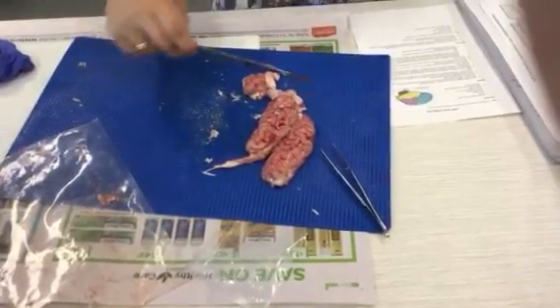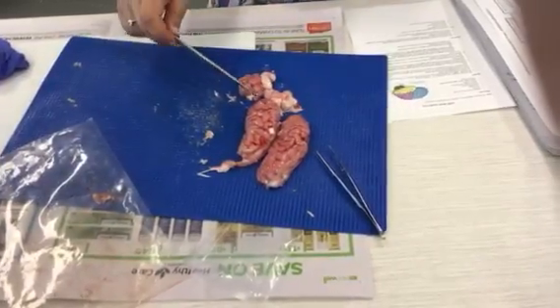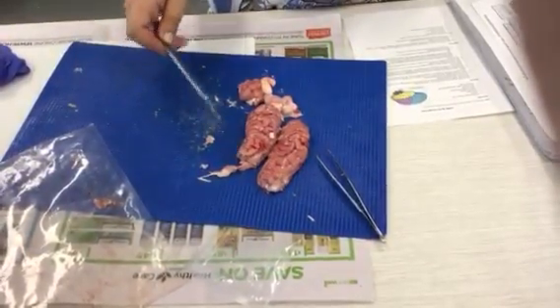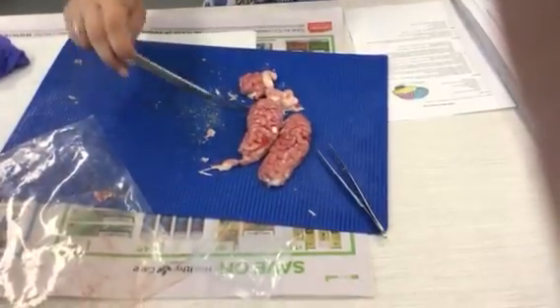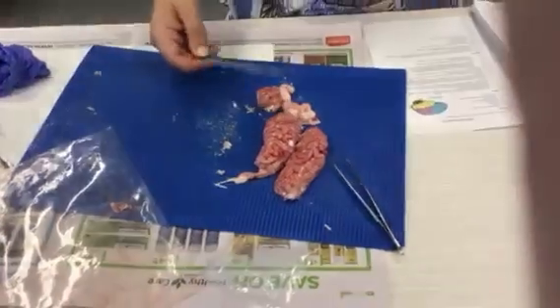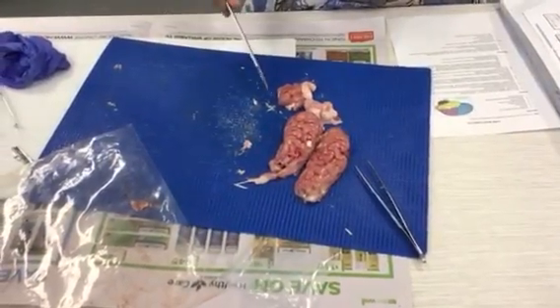We also looked at the fact that we can address the different parts of the brain in different ways. There is the forebrain, midbrain and hindbrain. We know that the forebrain is the forebrain because it's a bit more rounded and a bit more resilient than the hindbrain. The hindbrain squishes a bit more easily.